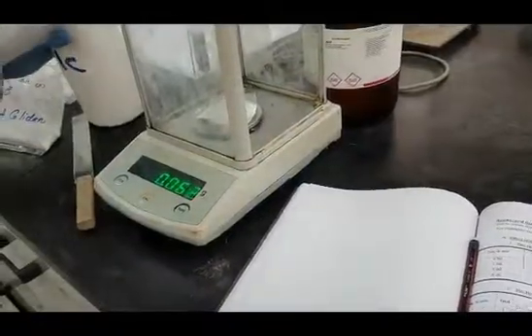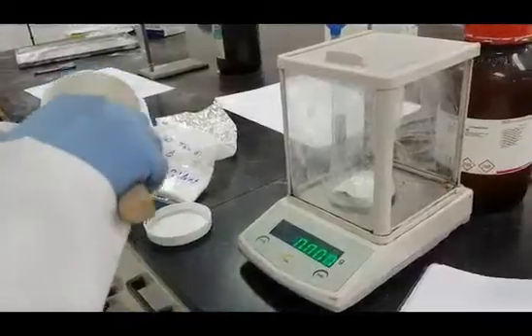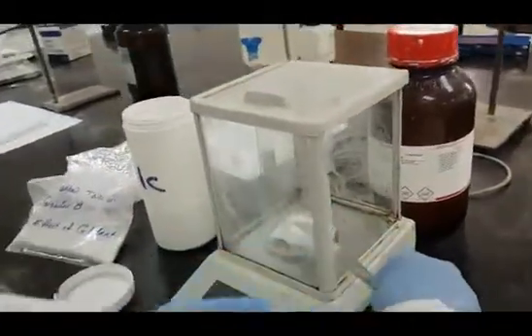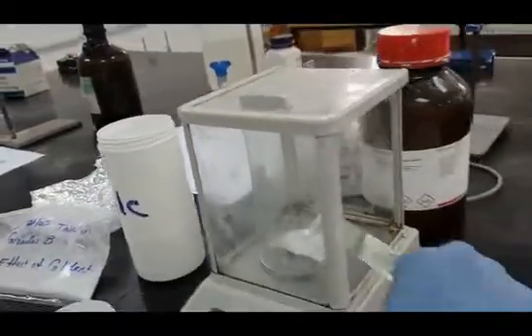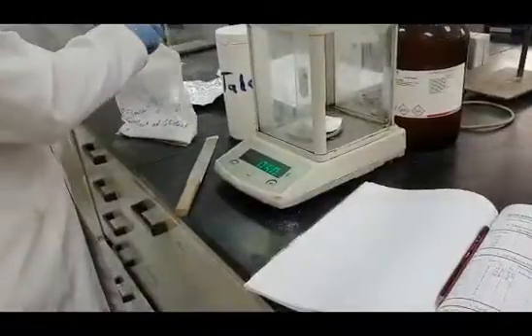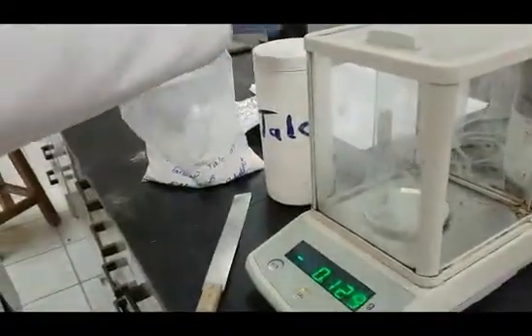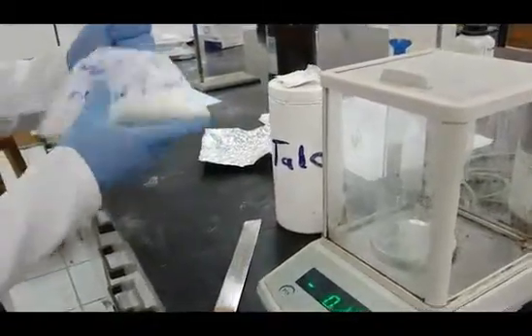Again, mixture 2 will be used to prepare mixture 3. This will be done by the addition of 2 grams of talc, and after performing the same required tests on the third mixture, we will use it to prepare mixture 4 by adding 3 grams of talc. And again perform the same 3 measurements or tests on mixture 4.